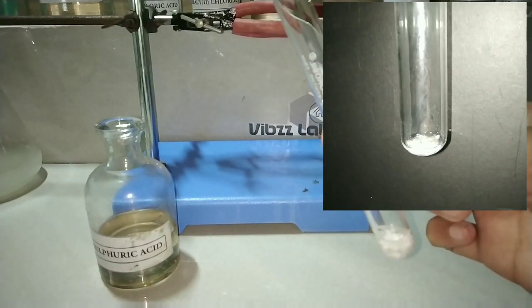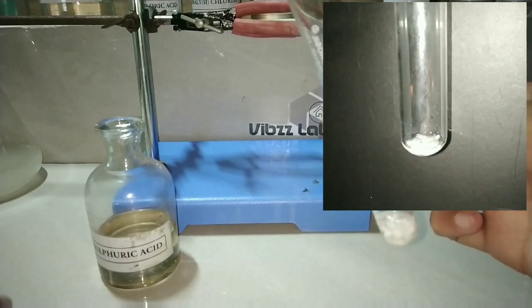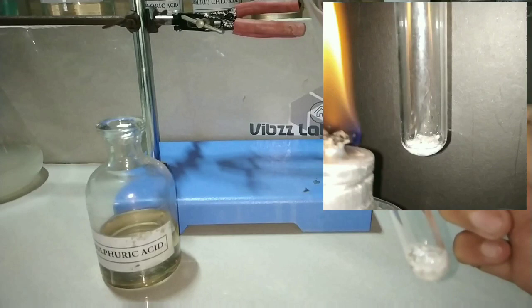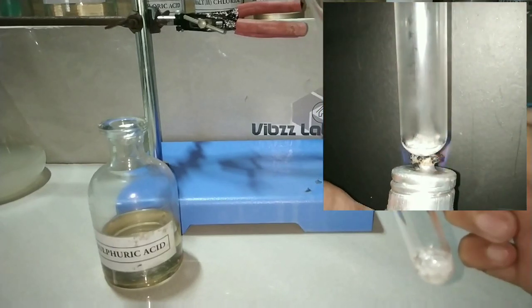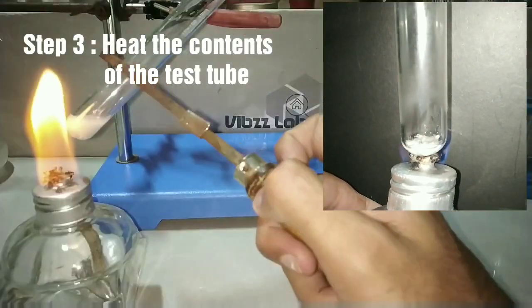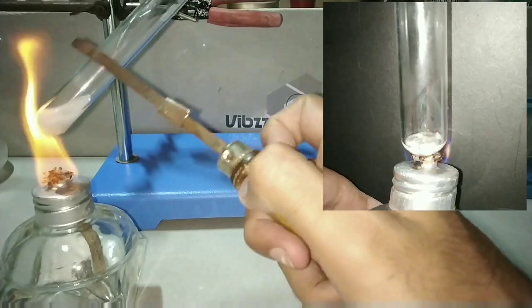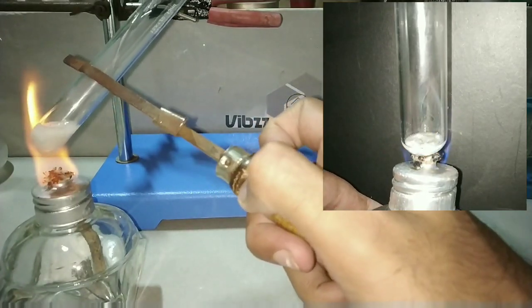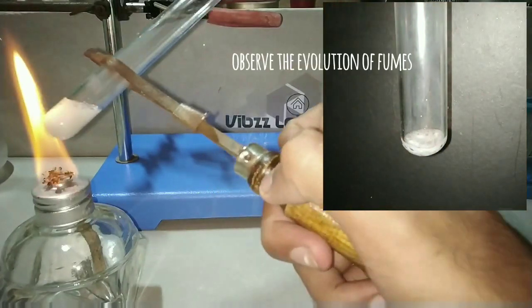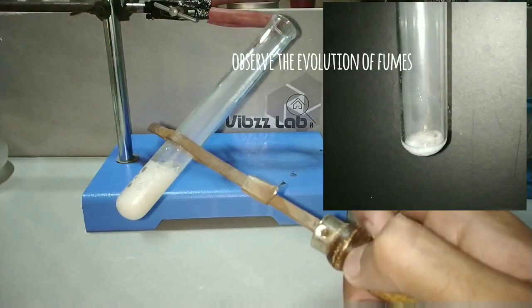On adding sulfuric acid, you can observe effervescence, which will be more evident by heating the contents of the test tube. The next step is to heat the contents to boiling. You can see that on heating, there is evolution of white colored fumes.